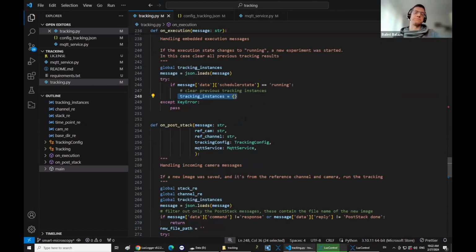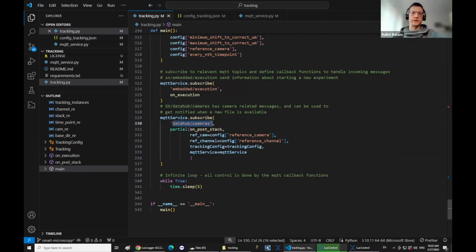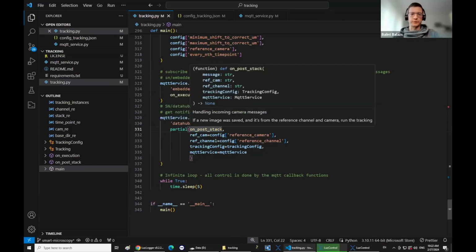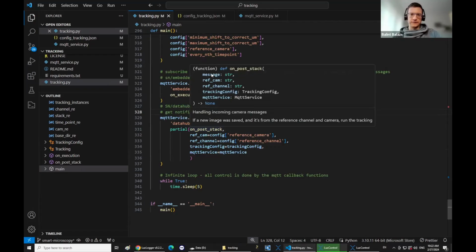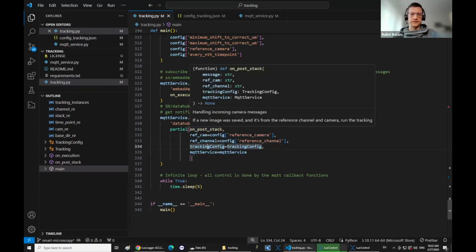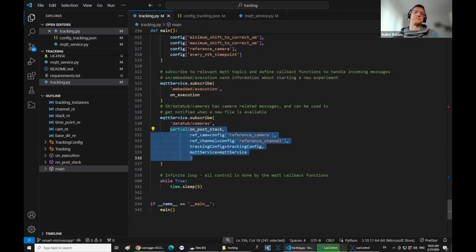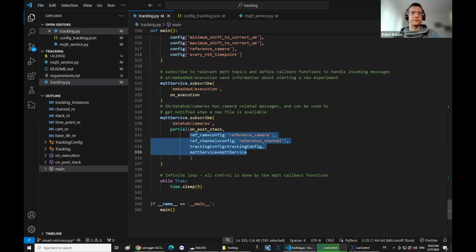And when the new image is recorded, if you go back in here, that is published to this data cameras topic, and then you can call this post stack on post stack function. Here, I don't know if you guys are familiar with this partial construct in Python, but basically this on post stack has multiple inputs, and with this I just make a new function that already prefills some of the inputs of that function from the configuration file. So I include like 4 parameters, and then I think the message is still empty. So basically, this returns a new function with just one input parameter, which is going to be the message, and all the others are fixed to these coming from the configuration file.